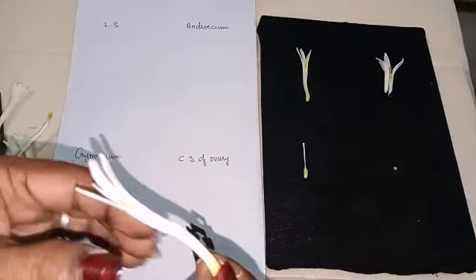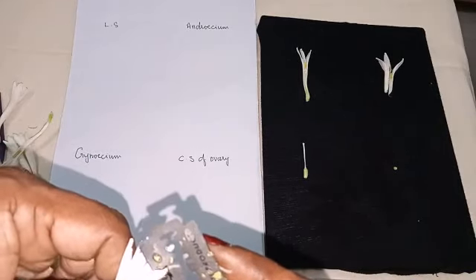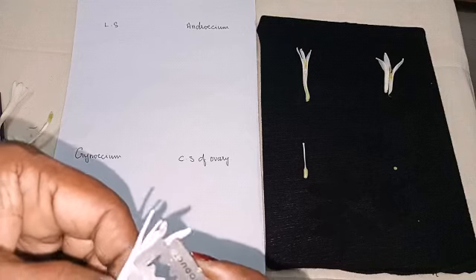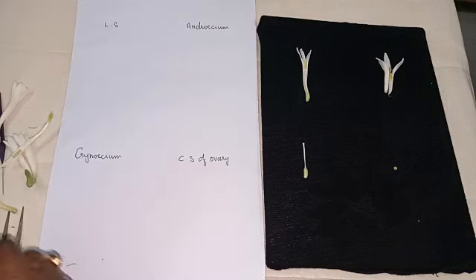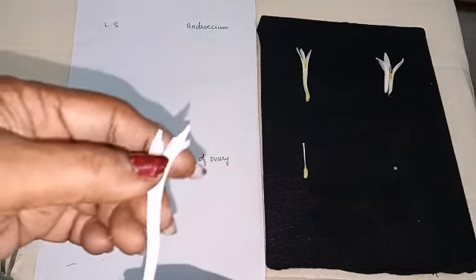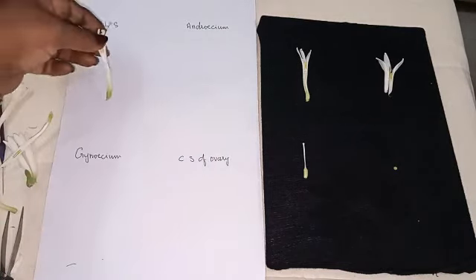Now we have taken the LS. Okay, we have to keep the LS there.